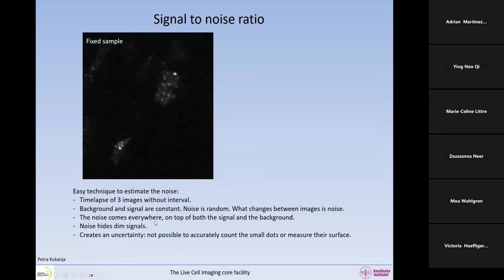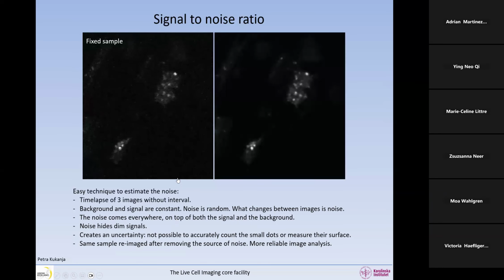So you can see in here that it creates an uncertainty. If our scientific question requires us to accurately count the small dots and measure their surface, you can see that we are a bit unable to see where these dots start and end. Sometimes we even wonder if there is a dot or not, just because the noise is on top of the signal. So it creates an uncertainty.